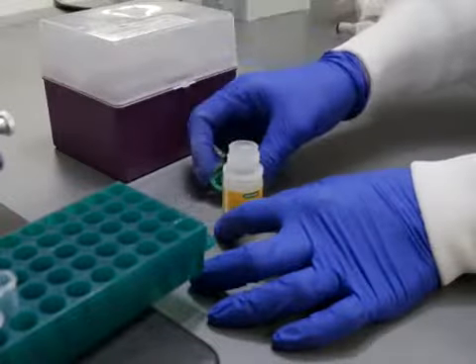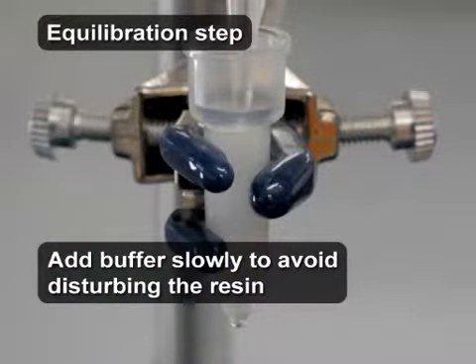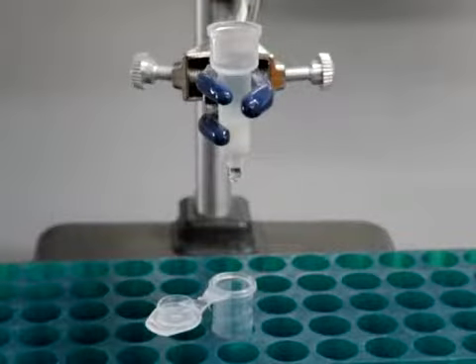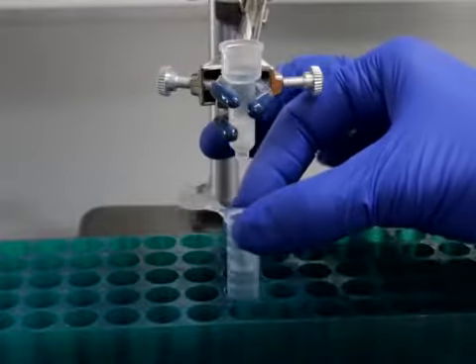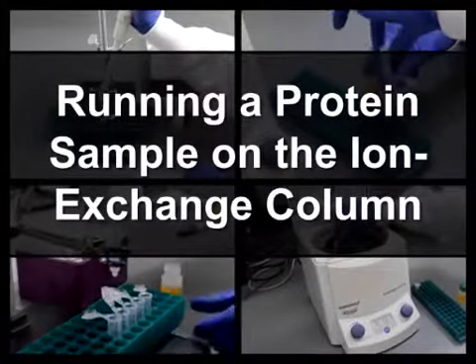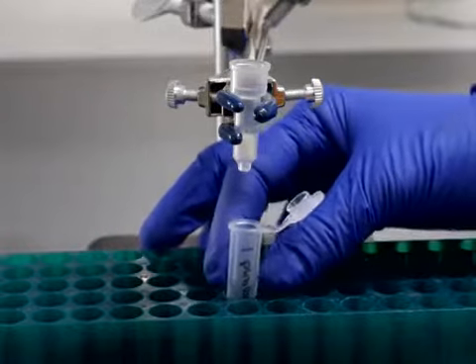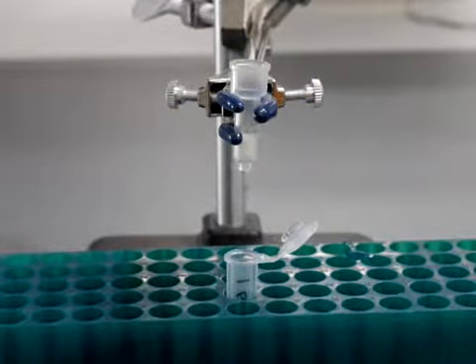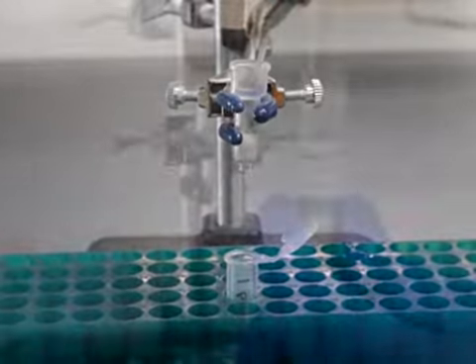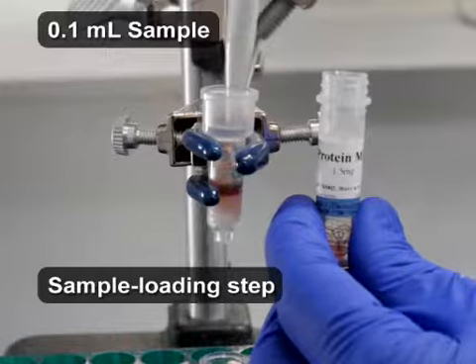To prepare the column, equilibrate it by loading a column volume of buffer, in this case 0.3 milliliters. Let the buffer drip out of the column into a waste vial. After a column volume of buffer has exited, repeat the equilibration step. To run the experiment, place a 2 milliliter centrifuge tube labeled Unbound 1 below the column. Carefully load 0.1 milliliters of the protein sample onto the top of the column.